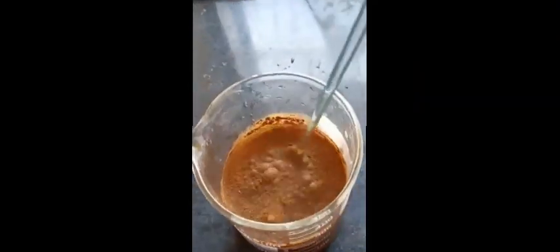Then take water in a beaker, add clove powder to it, and stir it to mix properly and uniformly. Take care that the clove powder is mixed uniformly in the water.